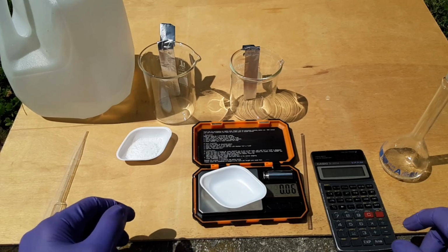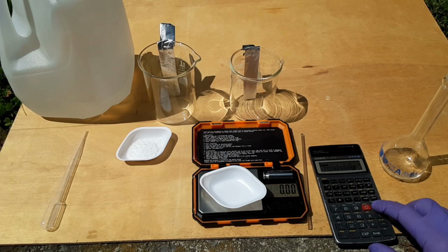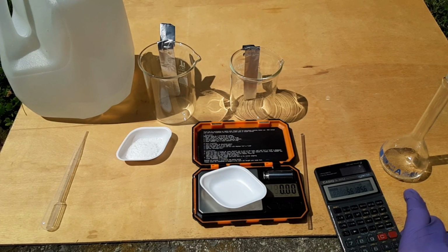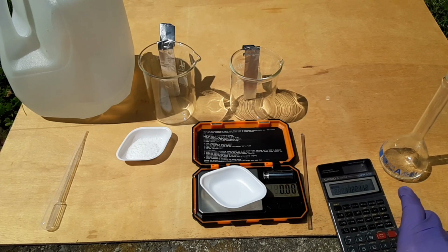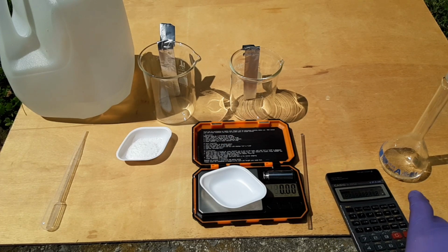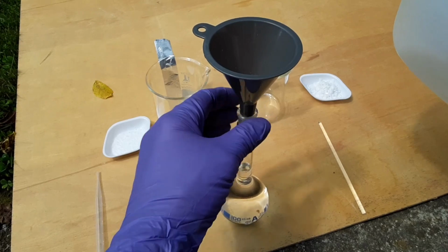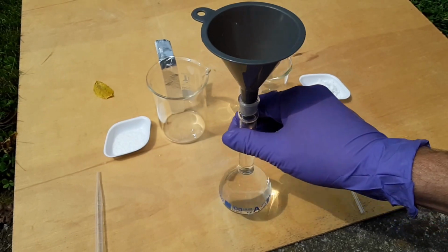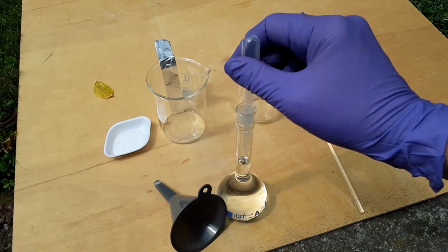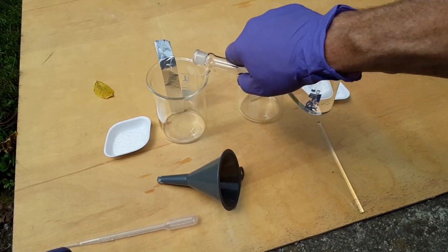Alrighty. Then for the potassium hydroxide we're going to need, I think it was 56.1056 grams per mole. And that would be 5.61056 grams. It's actually times 2, because we want 2 moles. So it'd be 11.221 grams. So we need 100 milliliters of water.